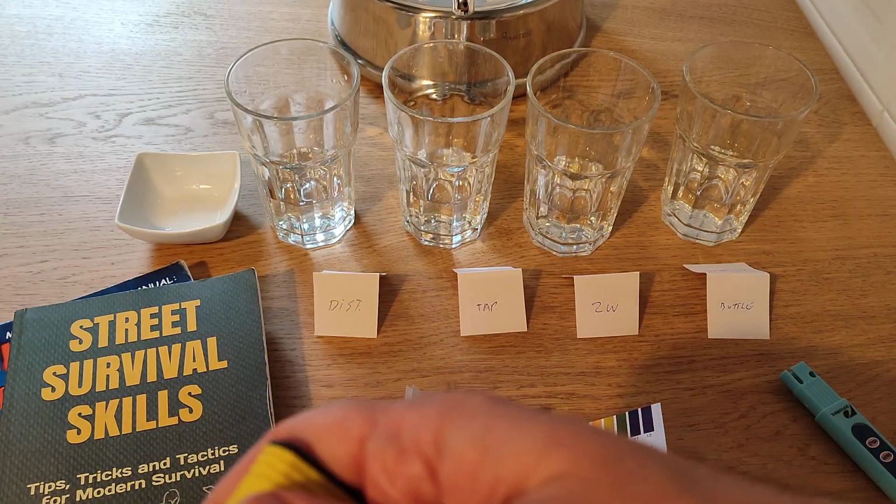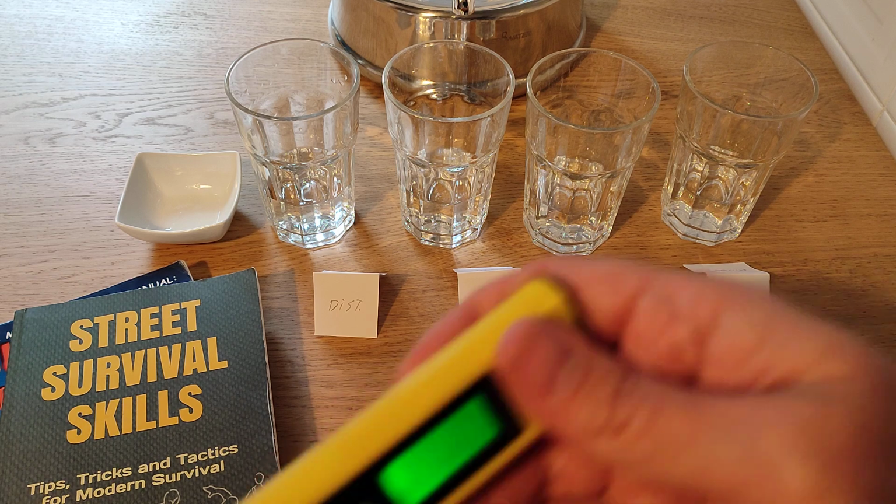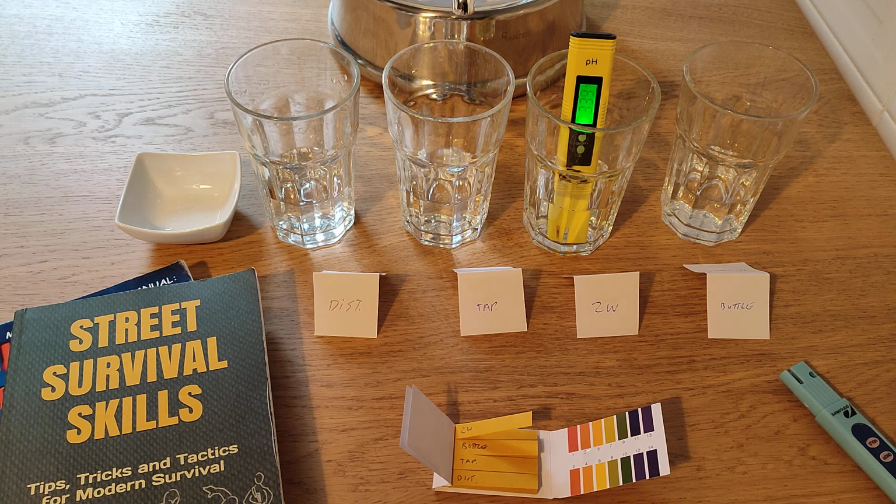I think that Perrier water, you're talking about high quality bottled water, Perrier is around 5, so that is super low. And here we go to our zero water testing. And zero water, as you see, it just gives me pretty acidic results with this tester.